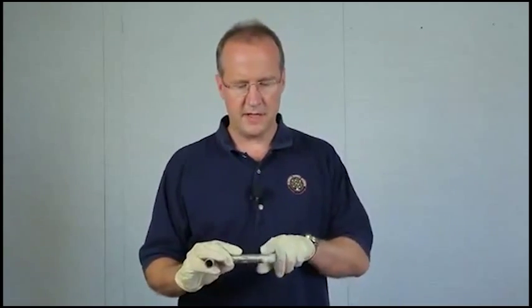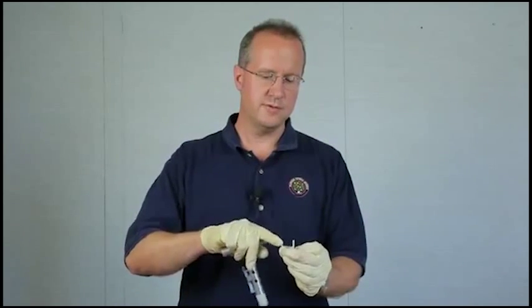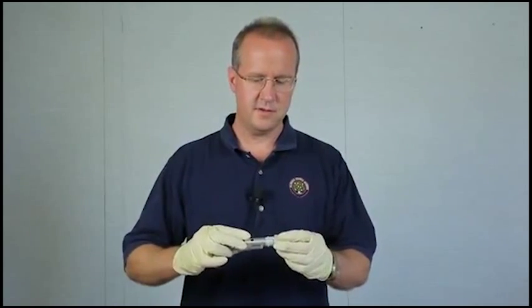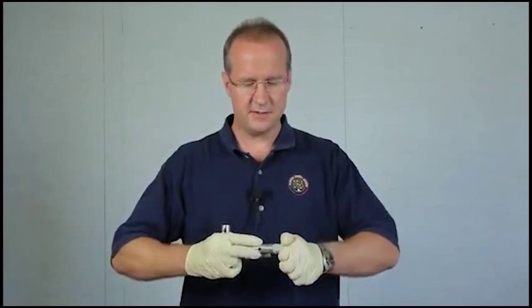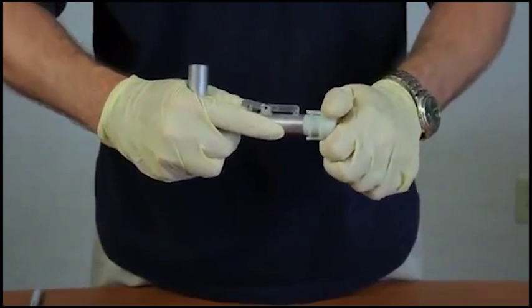You're going to clean off the outside of the body because that is where the cap O-ring seals. There are flats right here on either side of the sampler body. This is the cap. These are the wings. There are grooves in the wings. The wings go over the flats, push the cap on, and then give it a quarter of a turn twist.